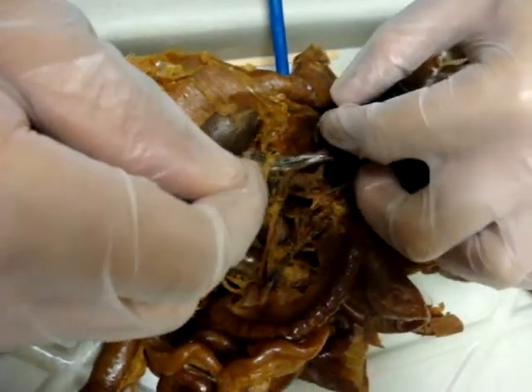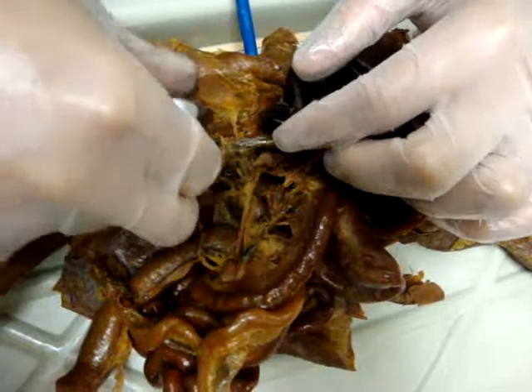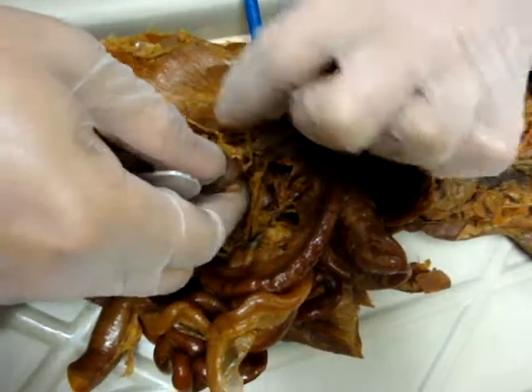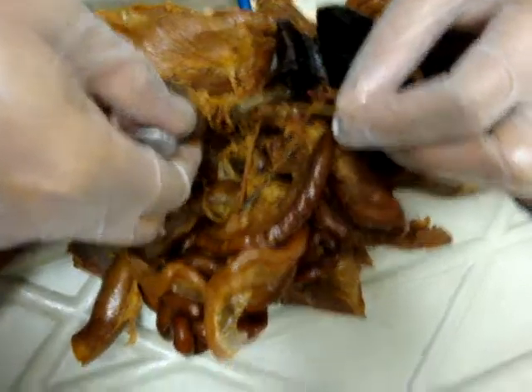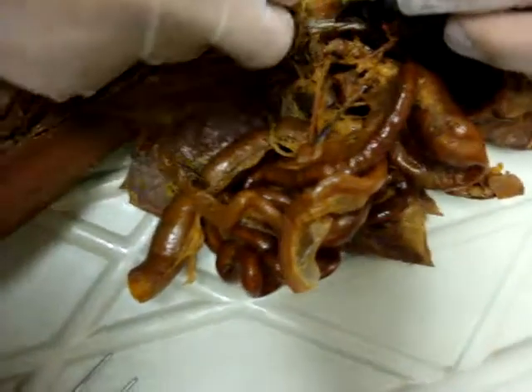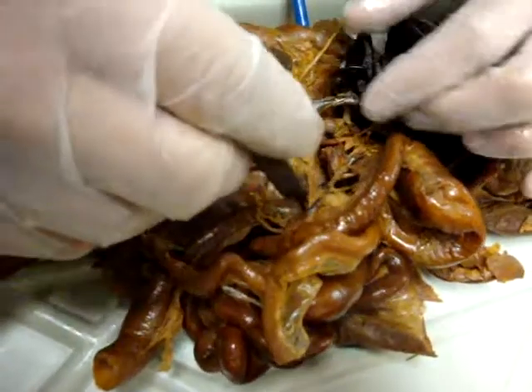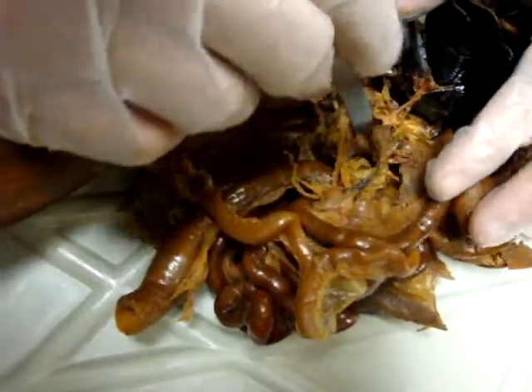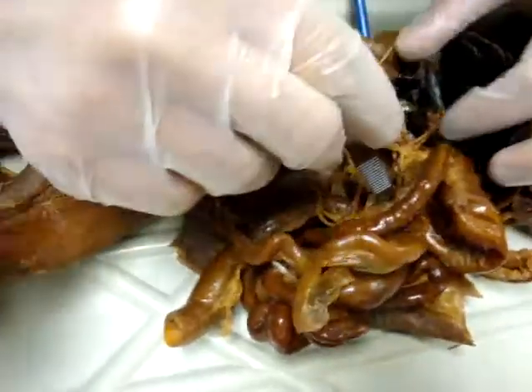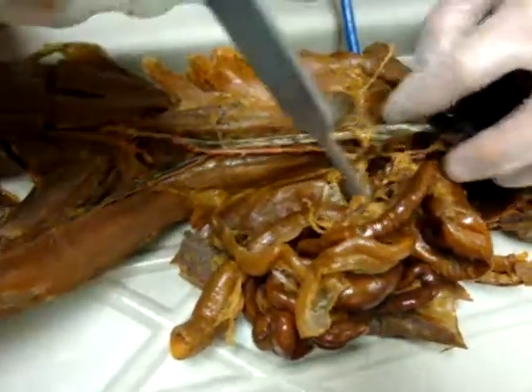See the ureter? The ureter — let me cut it off. The ureter is right here, and that will lead to the bladder. Do we have a bladder? The ureter will lead to the bladder. Let's go for a bladder. We don't have a bladder. Let's go for a bladder.